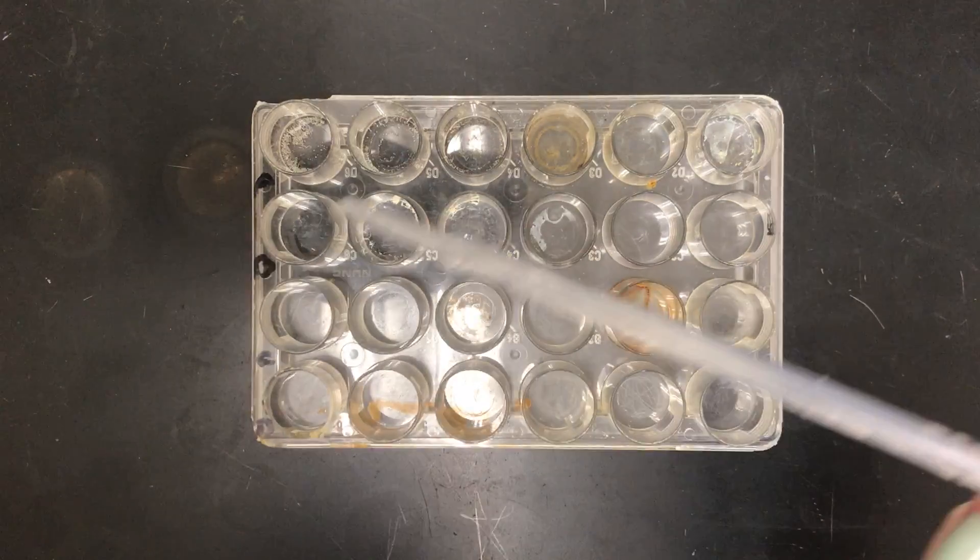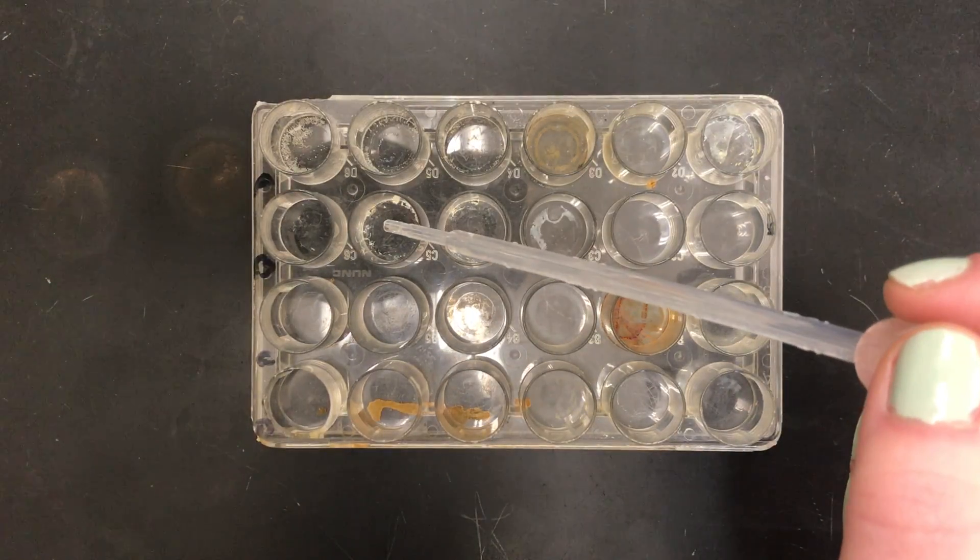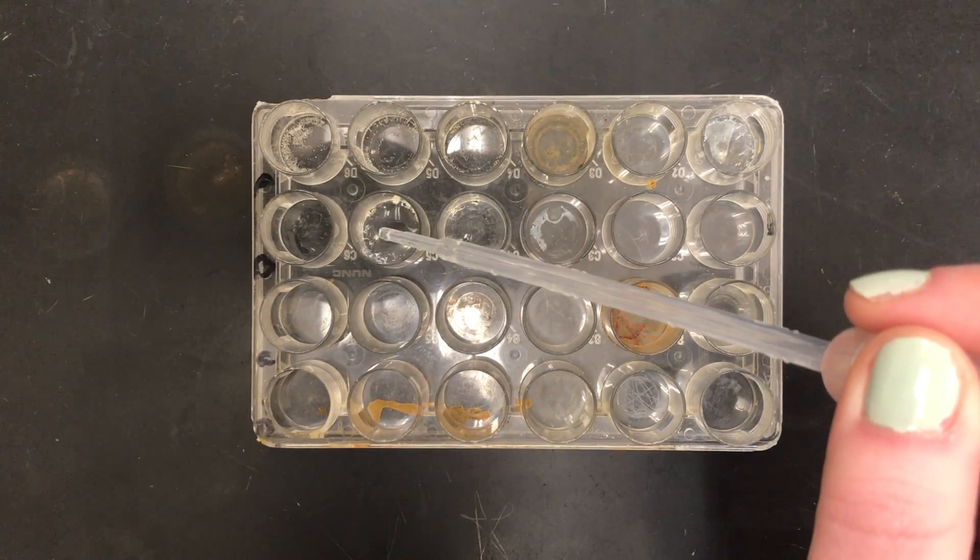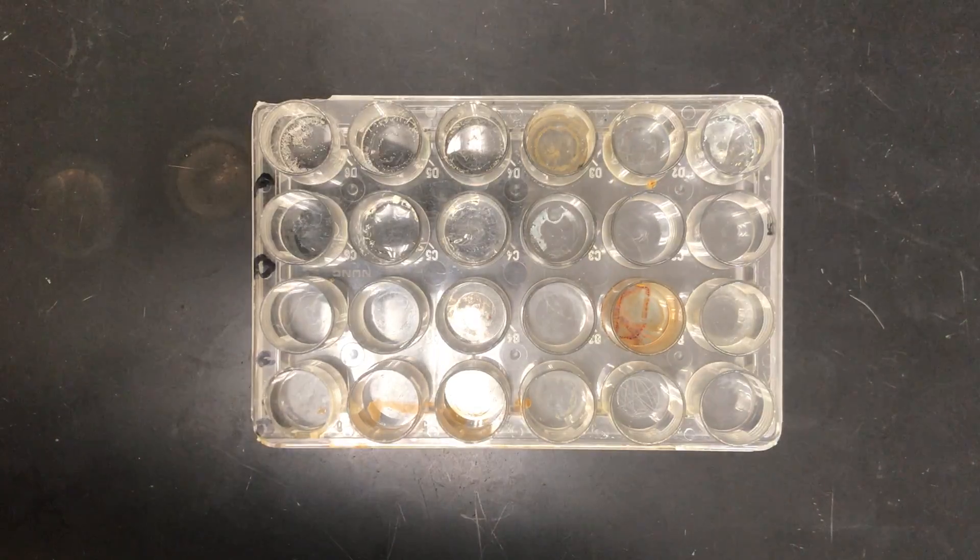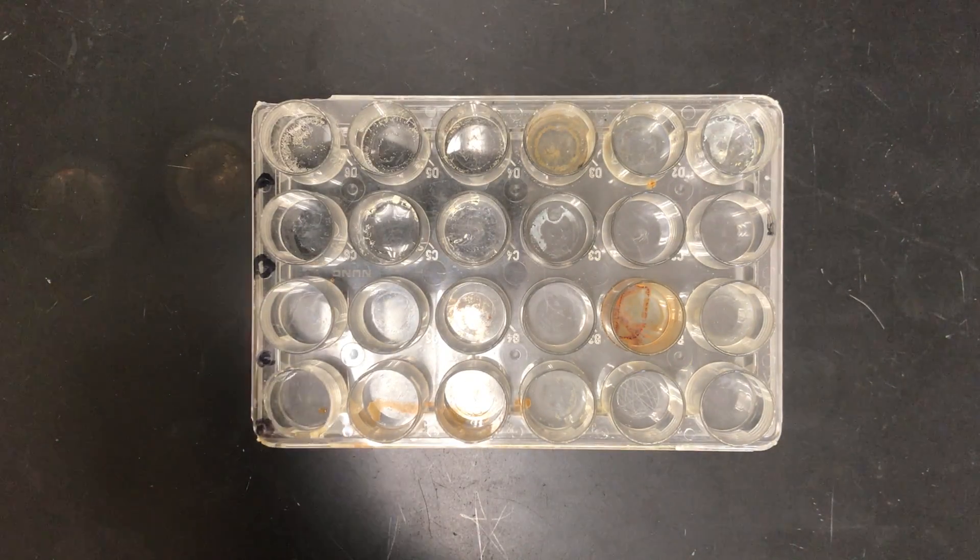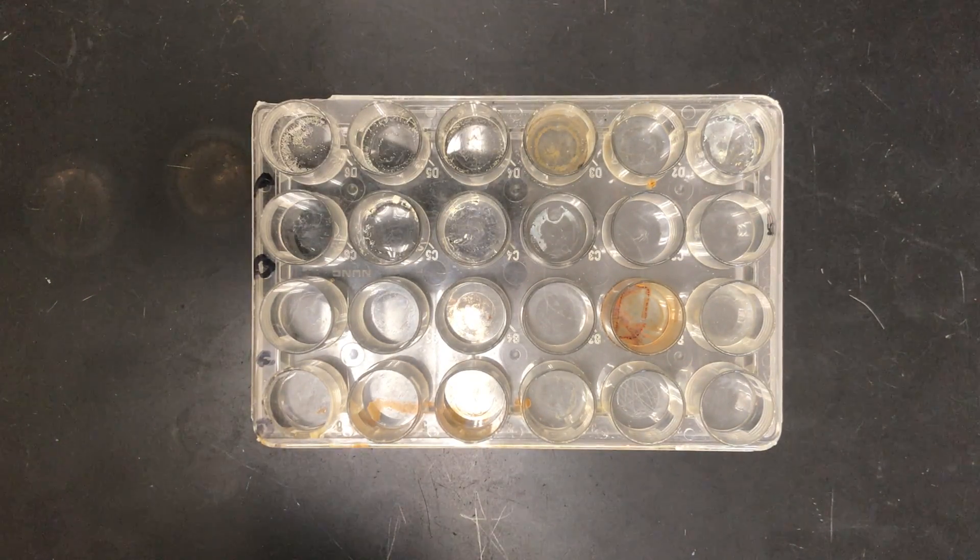All right, so our first possible murder weapon we're going in here with the potassium iodide, and then I'm gonna have that potassium iodide with sodium chloride.